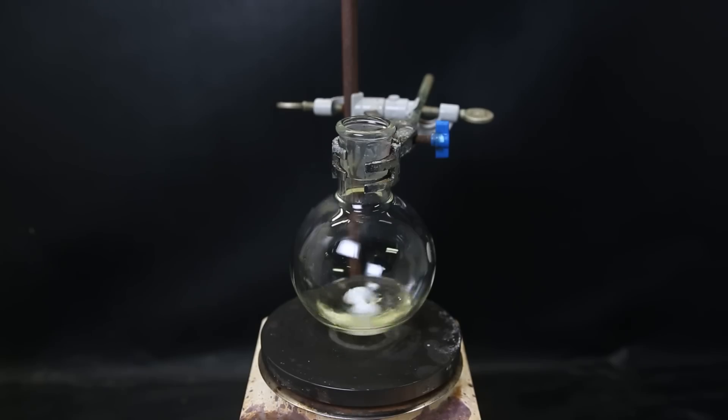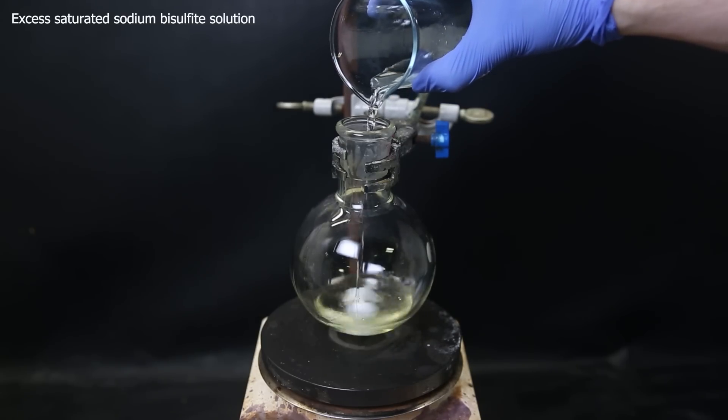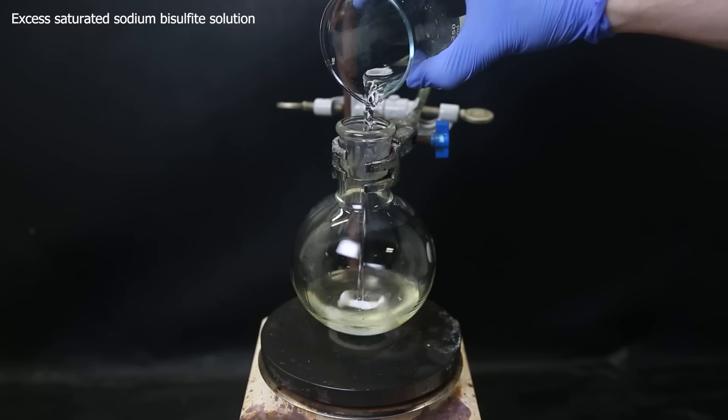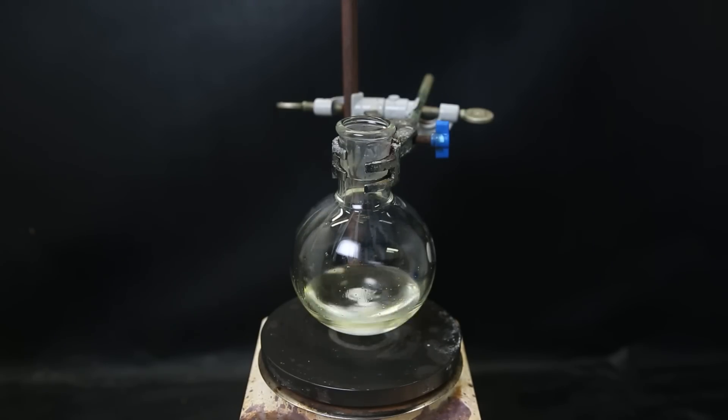NileRed just evaporated all completely, but it isn't strictly necessary. So to the ether solution containing the benzaldehyde, I add an excess of a saturated solution of sodium bisulfite. It takes a while for the reaction to be complete, so I just leave it overnight.